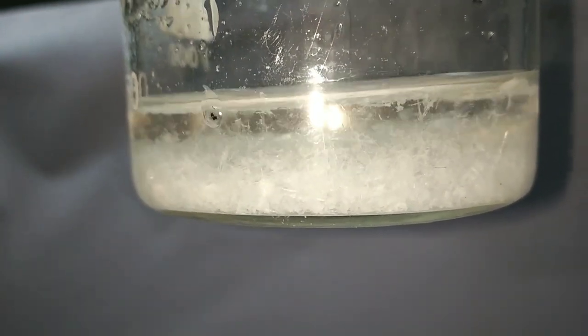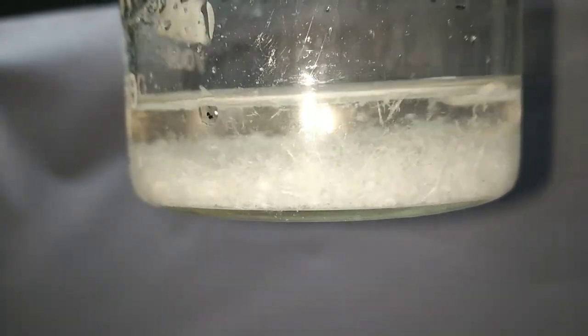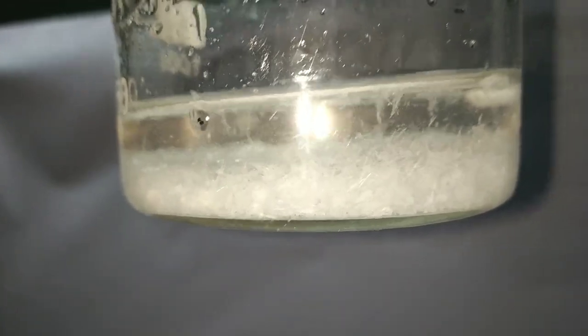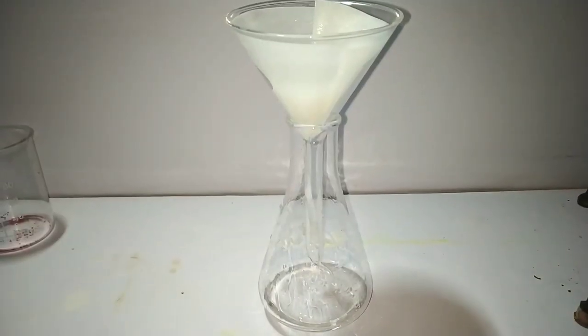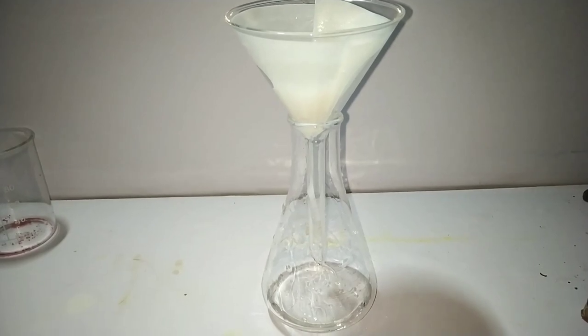I proceeded with filtration using simple gravity filtration, which is sufficient as the crystals formed are of larger size and water can be easily filtered out. If you have the equipment, you can use vacuum filtration instead.